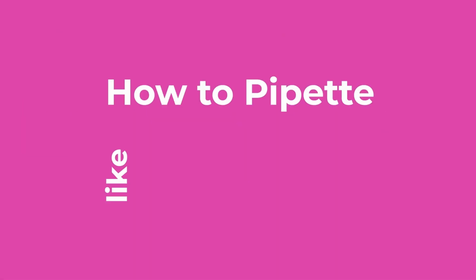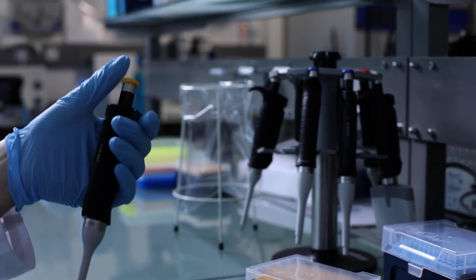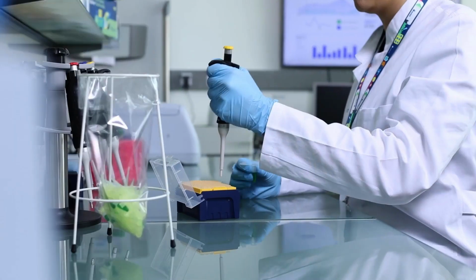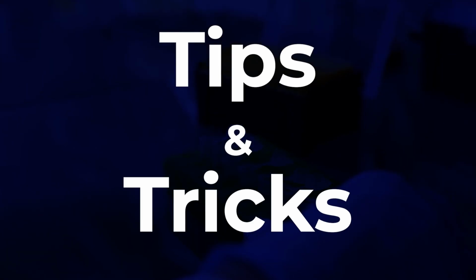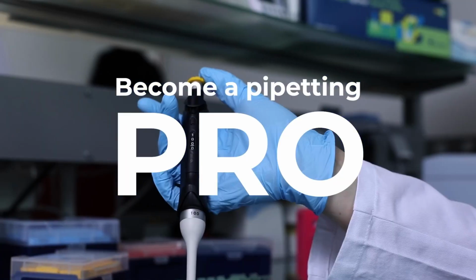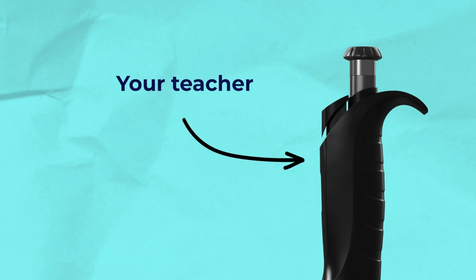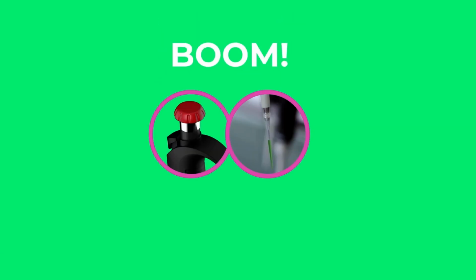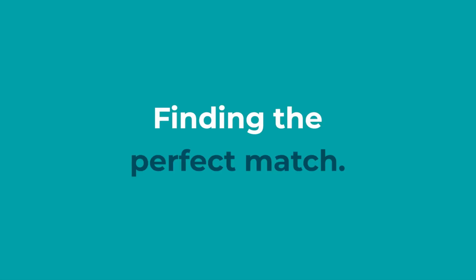This is how to pipette like a pro. We are going to cover the most important tips and tricks to get you up to speed in no time. Your teacher? Well, it's me, your Ergo 1 Pipette, the only one that's really qualified to be giving you advice on this subject. And today, I'm going to show you how to find me the perfect match when it comes to tips. Let's get started.